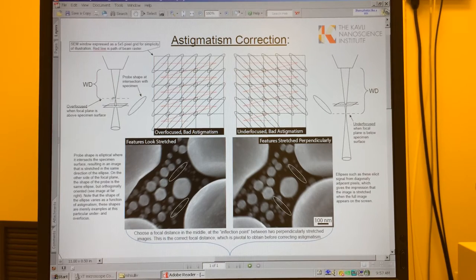So at focus, that's where the beam is at its smallest, and it's always circular. But below focus, if we have astigmatism, then the cross-section of that beam is going to be elliptical. Now, to understand why we get a diagonally stretched image, if we were to step that elliptically shaped beam on every pixel in our image, when we have a 2D image put together, we can see that the ellipses align, and in this case, we'll be able to pull signal from along this diagonal.